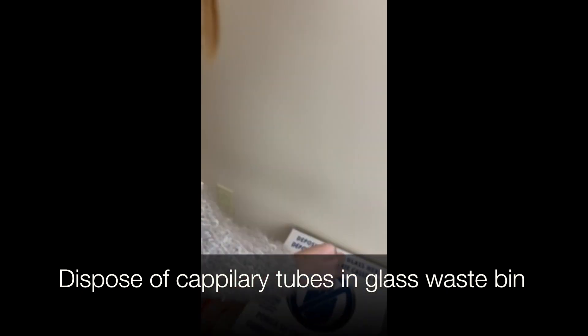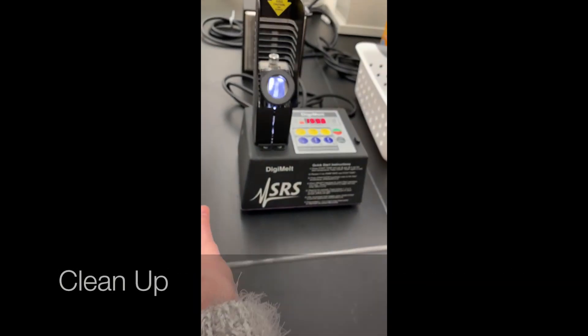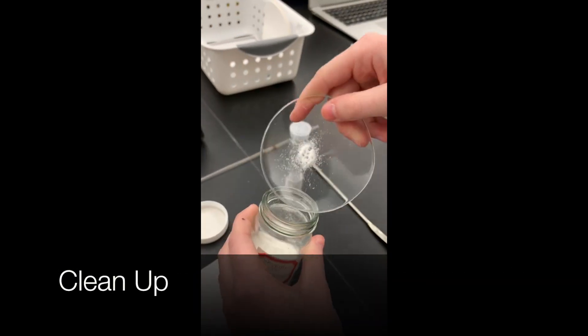To properly dispose of capillary tubes, you take them to the glass waste bin. And then you need to clean up the rest of your area.